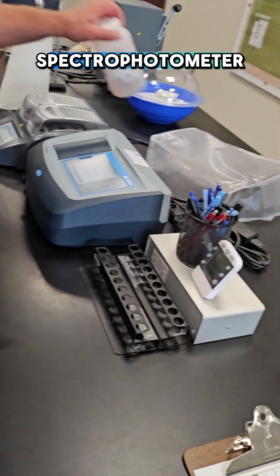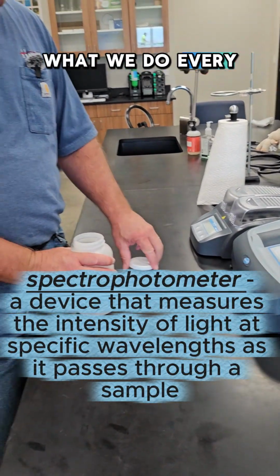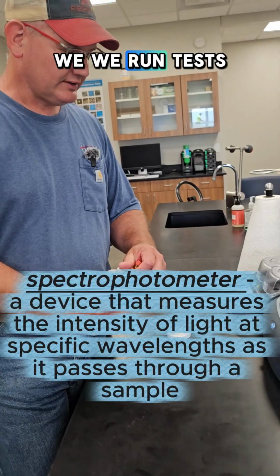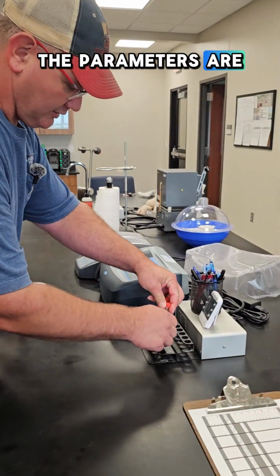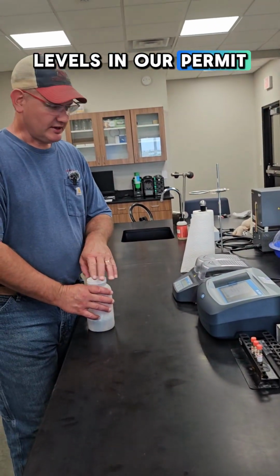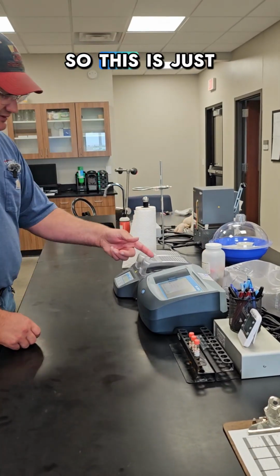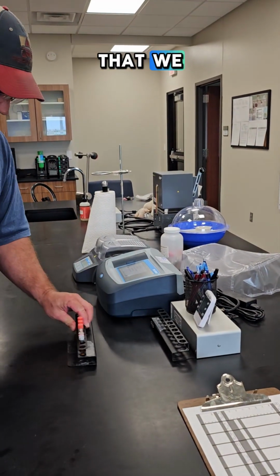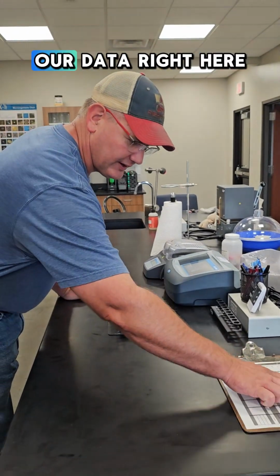This is a spectrophotometer, and what we do every day is we run tests on our water to make sure the parameters are where they're supposed to be, and we're not exceeding any levels in our permit. This is just one of the ways that we check on a regular basis, and then we record all of our data right here.